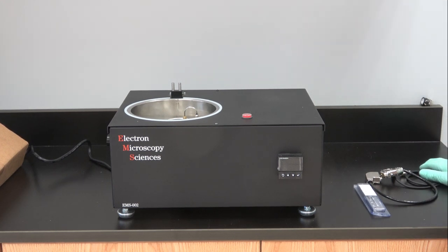Hello, today I would like to talk to you about setting up the EMS-002 rapid immersion freezer or plunge freezer, however you like to call it.